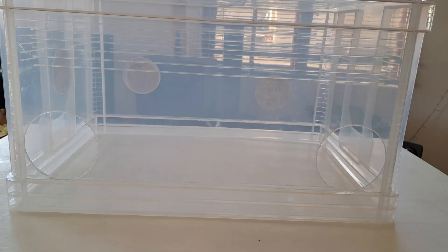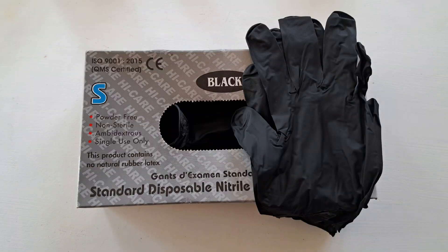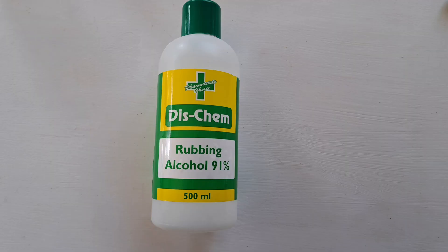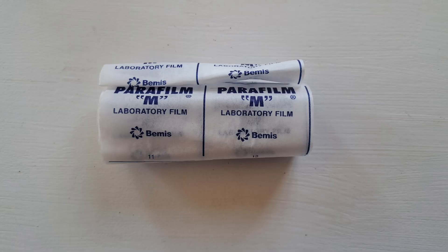You need an oven and a stove. You will sterilize your petri dishes in the oven and use your stove to boil the water in your pot or pressure cooker. You need your filled petri dishes, a still air box so nothing gets contaminated, and your liquid culture or multi-spore syringe depending on what you're working with. You also need gloves, rubbing alcohol, paper towels to wipe everything down, and parafilm to seal the petri dishes after inoculation.